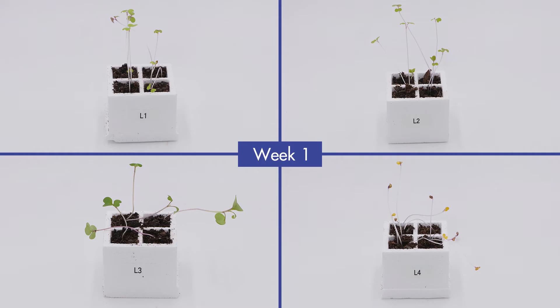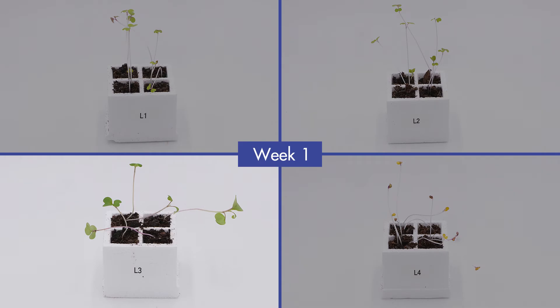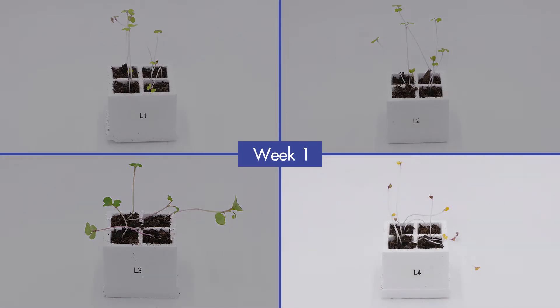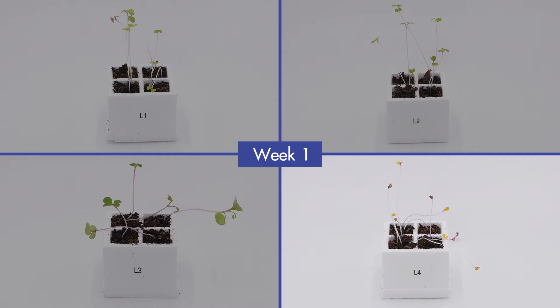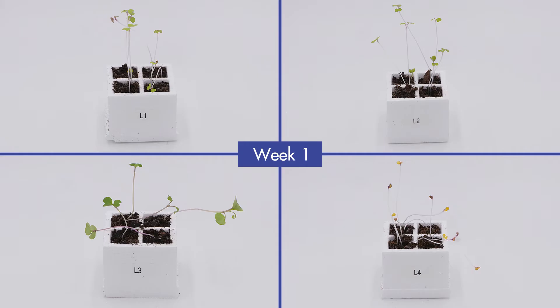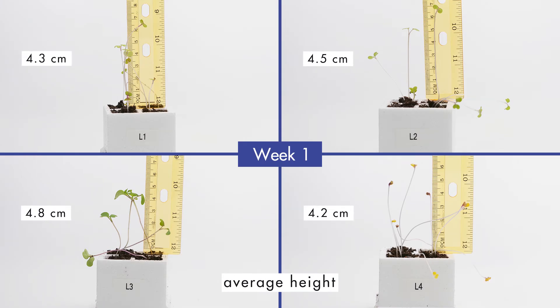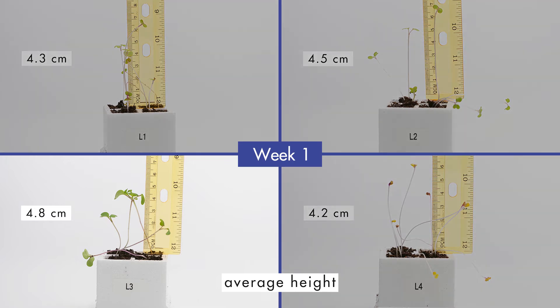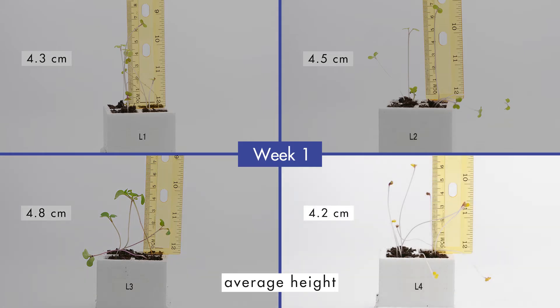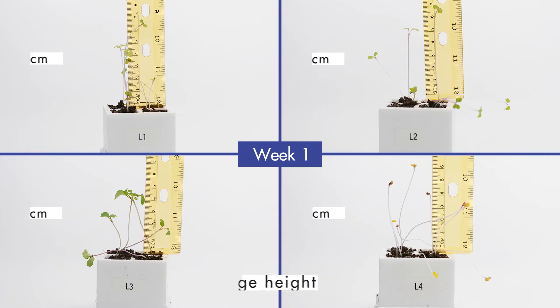Observe the four groups of plants at the end of week one. Notice that the plants in group L3 look the healthiest — their leaves and stems are larger and greener. The plants in group L4 do not look healthy; the stems are white and the leaves are yellow or brown. None of the plants in any group have produced any flowers. Record your observations for all four groups in your journal. The plants in group L3 have the tallest average height, while the plants in group L4 have the shortest average height. Record the average height of the plants in each group.